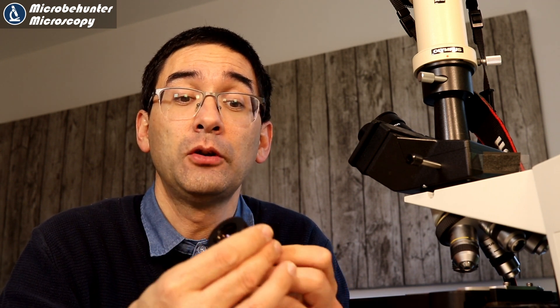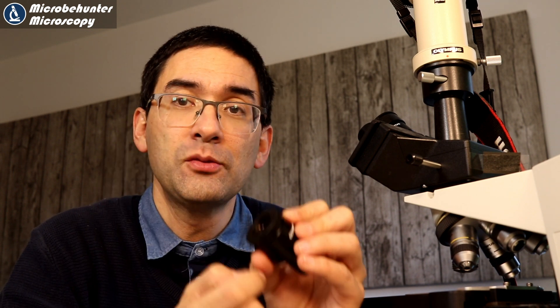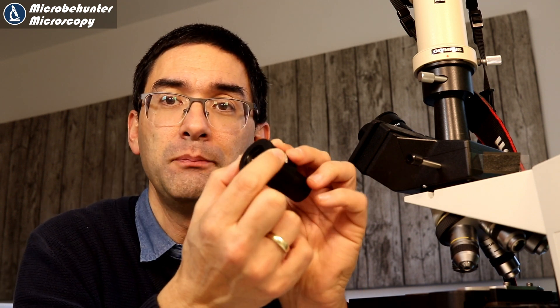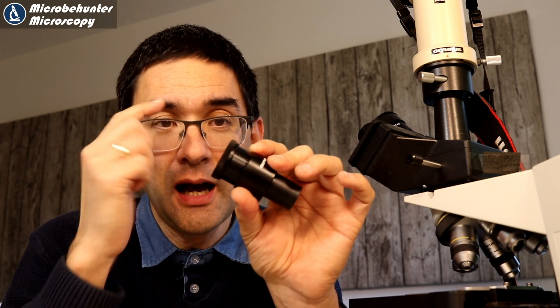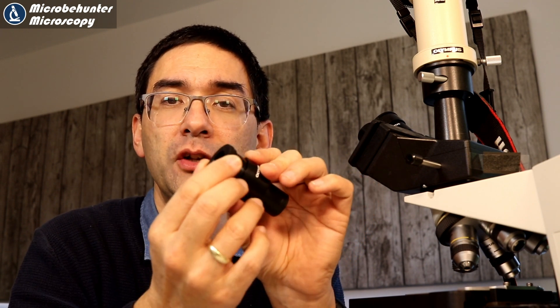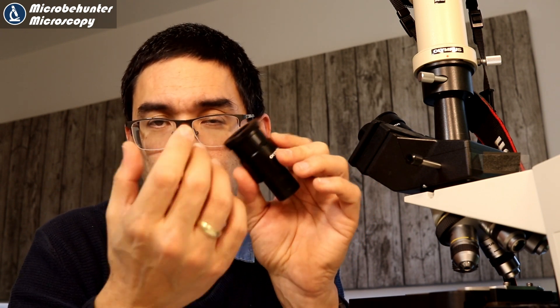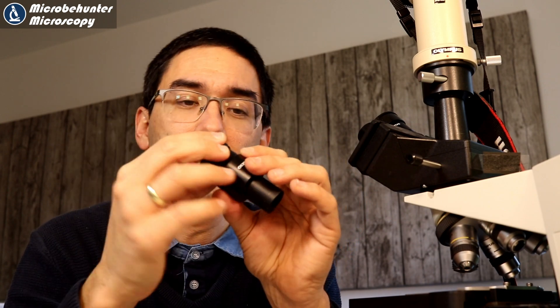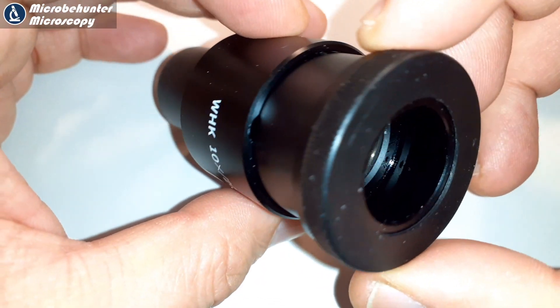For example, these are eyepieces that have a long eye relief. For people who do not wear eyeglasses, you can simply extend the front part and rest your eyebrows on it, which adjusts you to the correct eye relief even without glasses. So that would be one thing I'd be looking for.